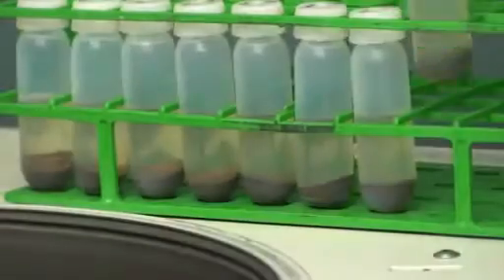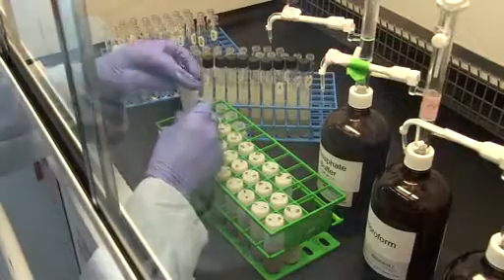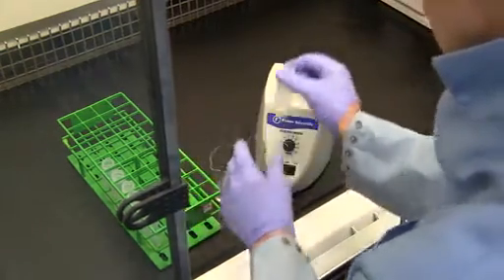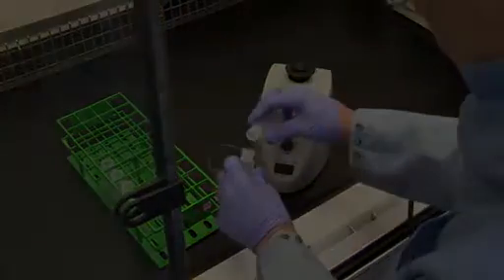The extractions are carried out in 30 milliliter Teflon centrifuge tubes, which must be solvent rinsed. Add 2 to 3 milliliters of hexane to tubes and vortex for a few seconds. Decant the hexane to another tube and vortex.